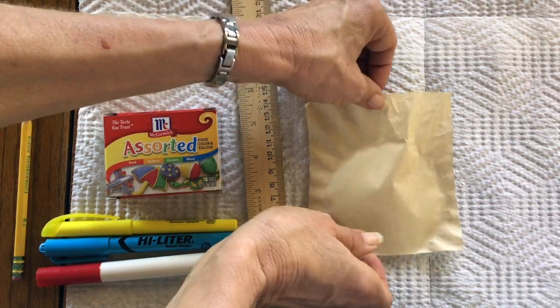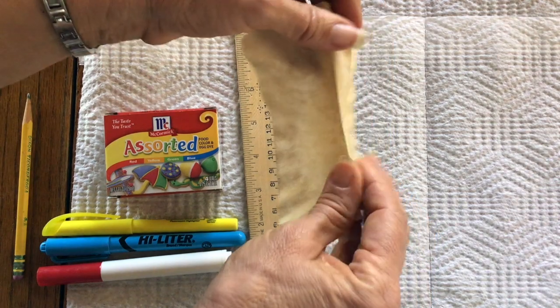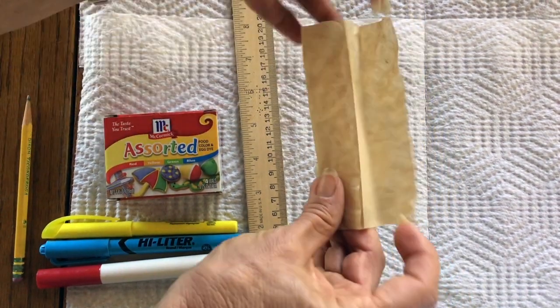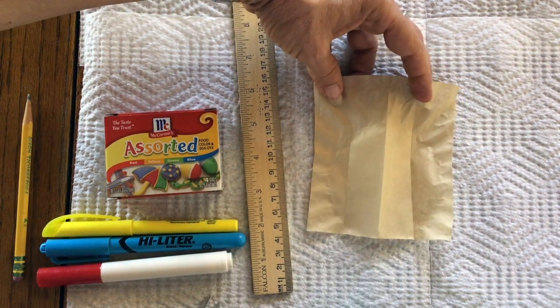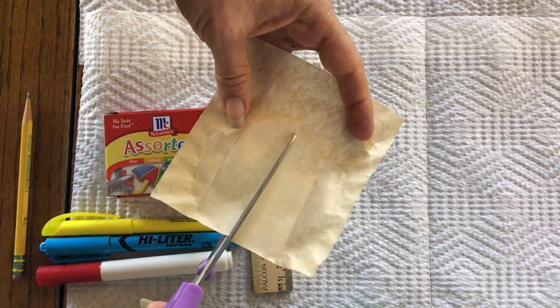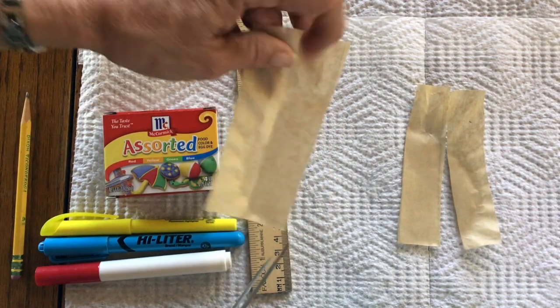Normally in the lab you would use chromatography paper, put four different colors on it, and stick it inside a beaker. Since I don't have a beaker large enough at home, I'm going to use four different glasses with a piece of paper in each one. I'm folding my chromatography paper into four equal quadrants — in a face-to-face lab you would set this in your beaker as directed in your lab manual. We're going to cut the paper into the four equal quadrants, and each piece will have a different color of food coloring on it.